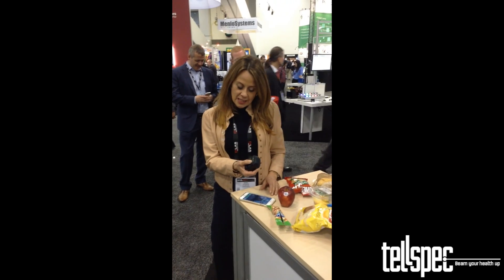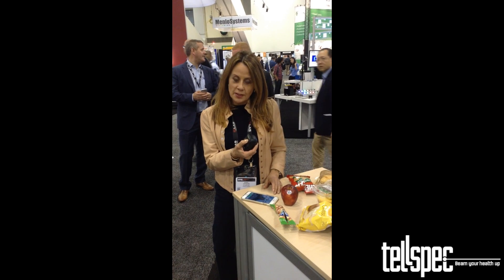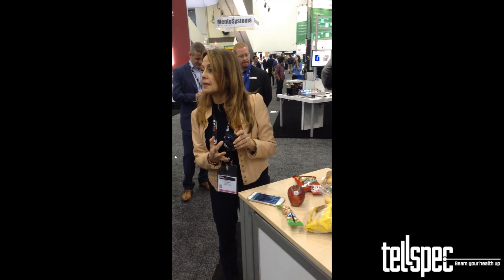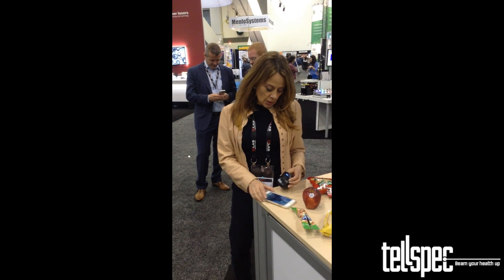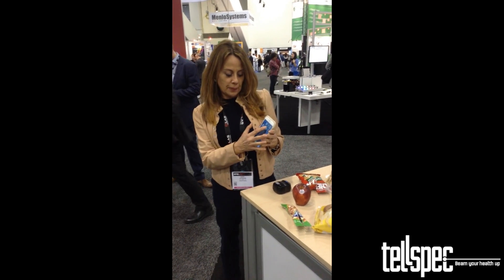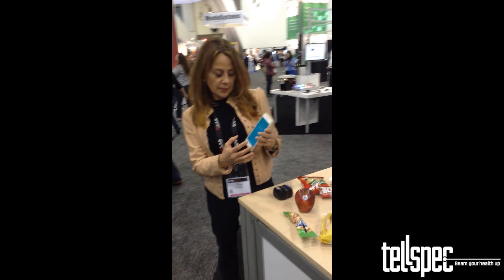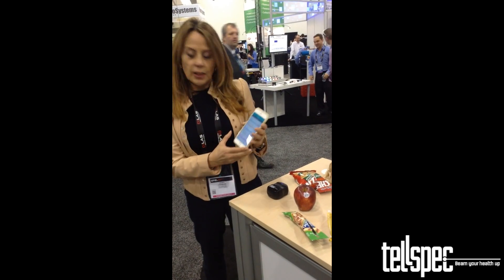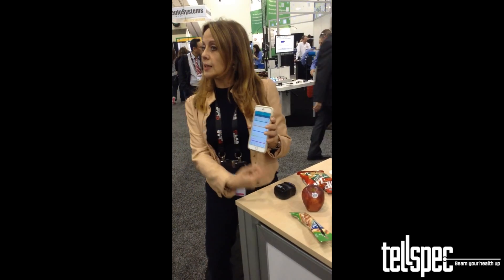I'm going to press the button to turn the Bluetooth on, and as soon as the blue button is on, we know that the Bluetooth is active. Now I'm going to open the app, and it's connected automatically.